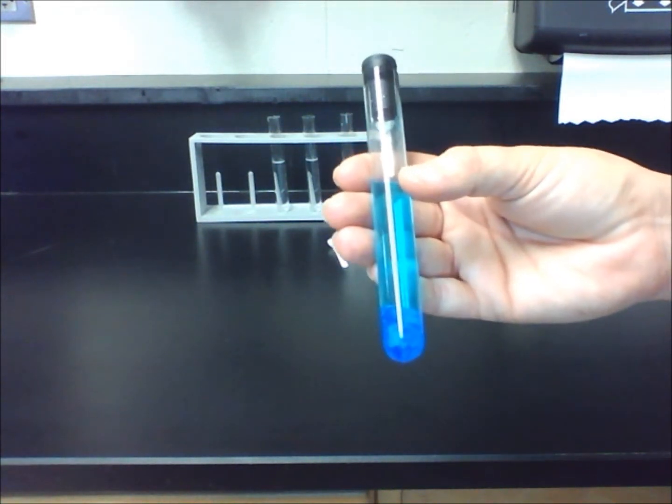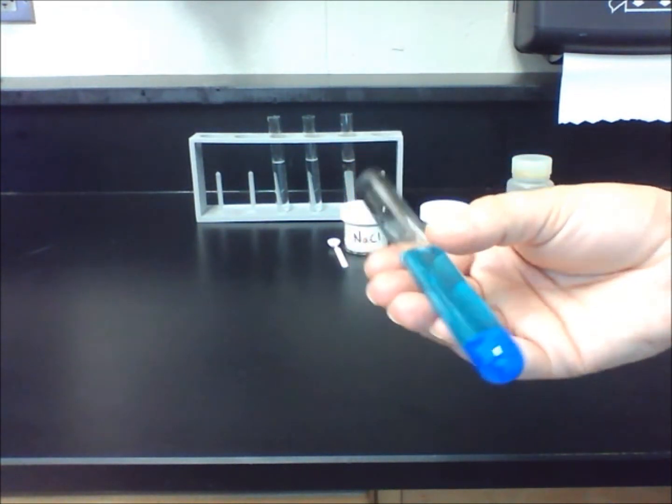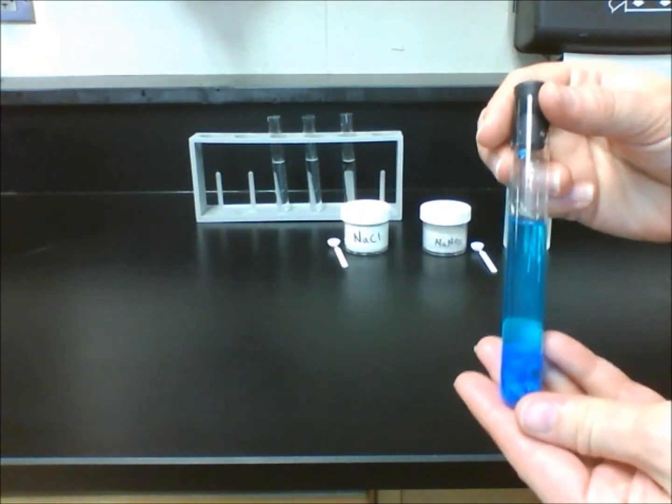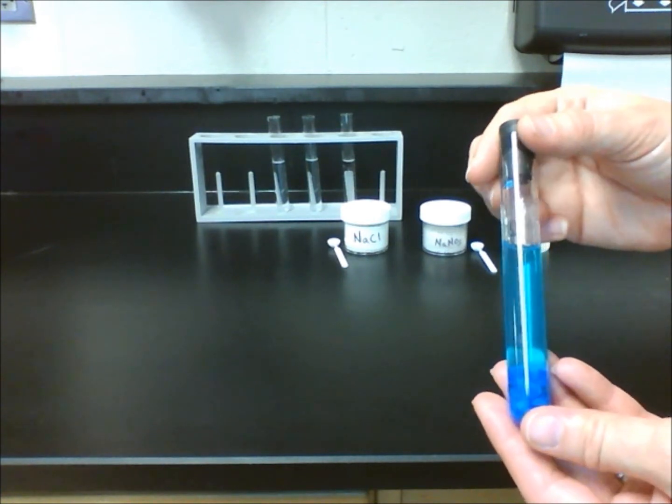Let's first take a look at a test tube containing a blue liquid. What observations can you make about the solution? After careful examination, we can state that the liquid is clear but blue.